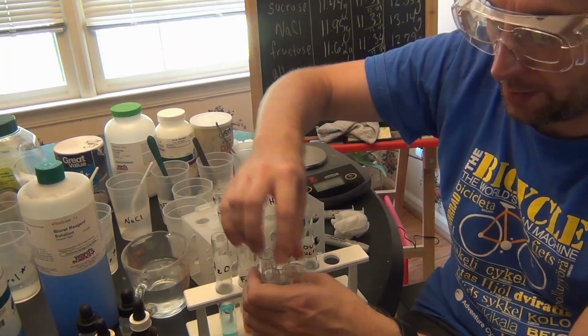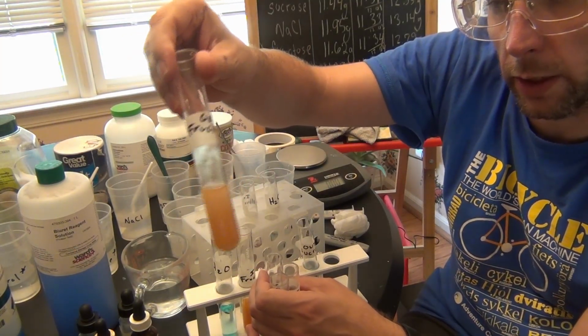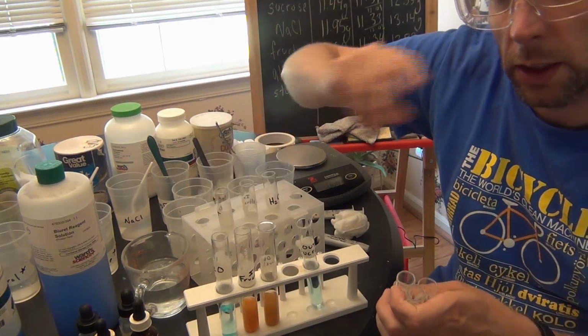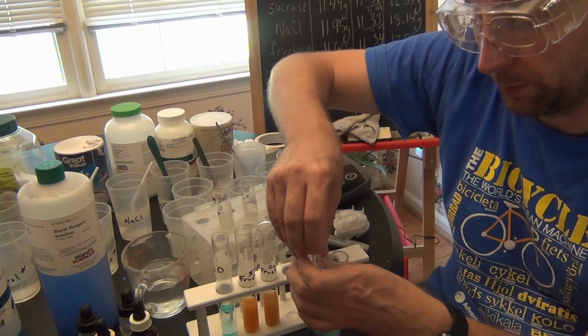Now, outside the fructose, you'll see it actually started as a slight green color, and as I kept heating it, it got closer and closer to orange. It's not quite the same color but it shows that there is some definite fructose on the outside of the tube.